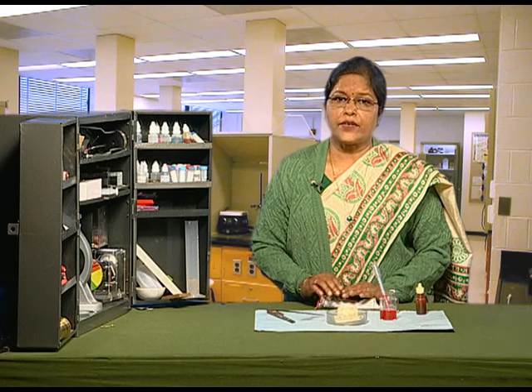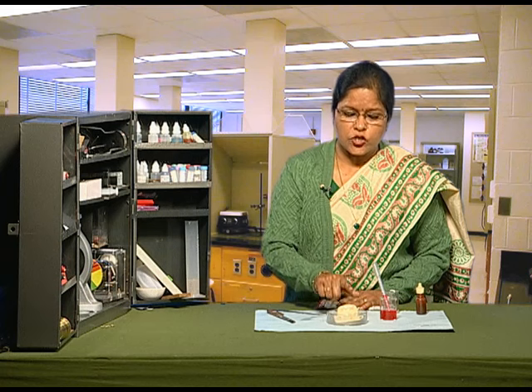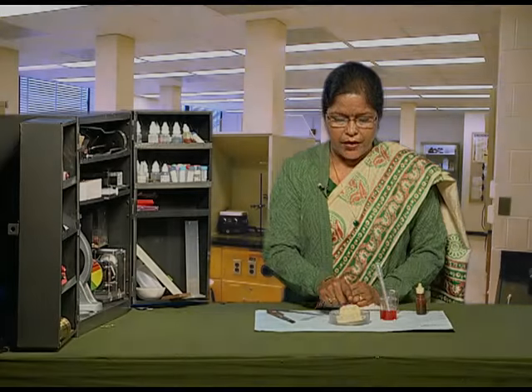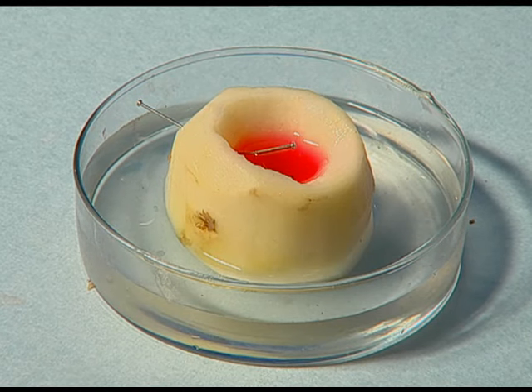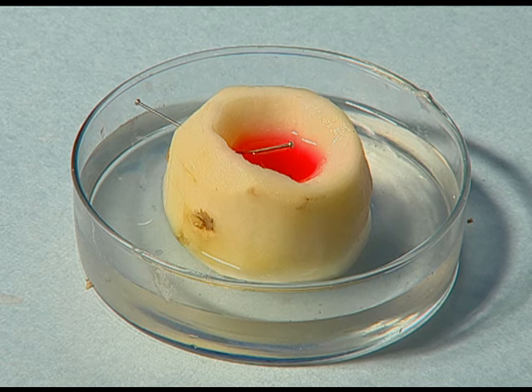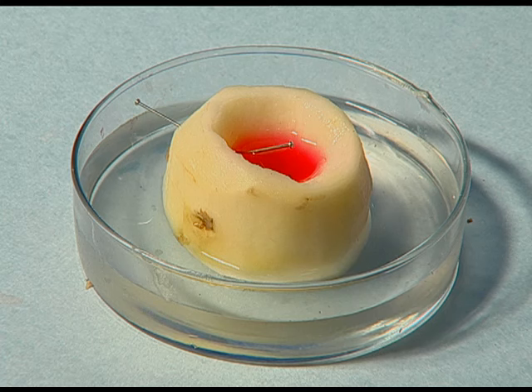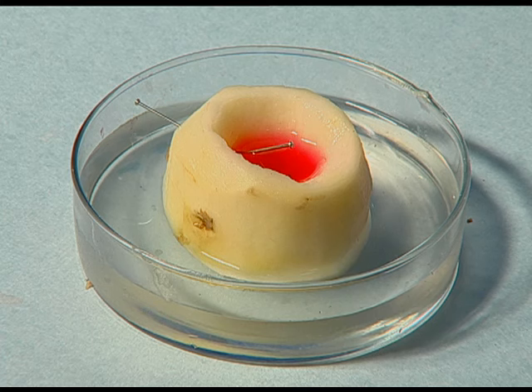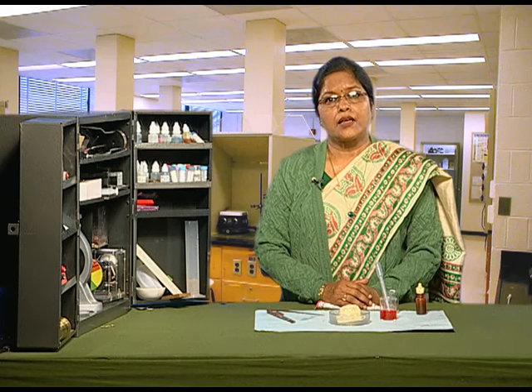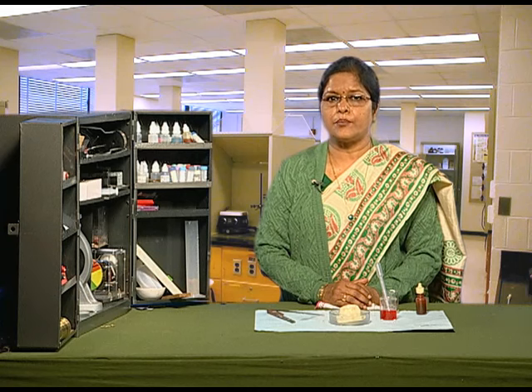After half an hour or so, we have to wait to see what will happen. We have seen that the water inside the cavity rises, because water has moved from its higher concentration to its lower concentration — that is, from outside to inside. That is how water moves from one cell to another in plants.